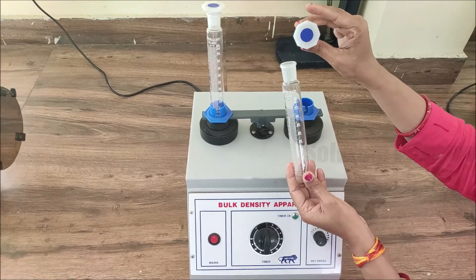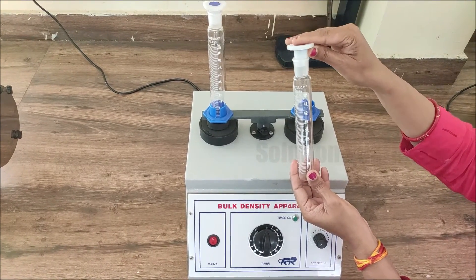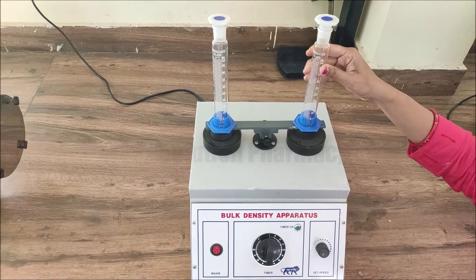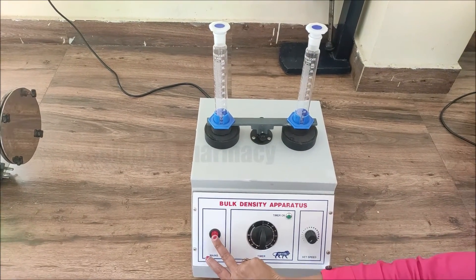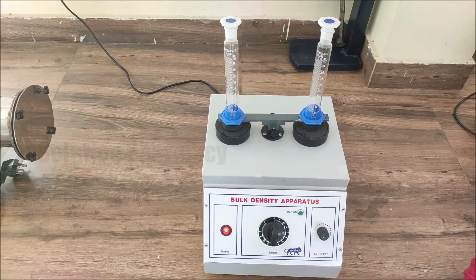Here you can see the cap of this measuring cylinder, and we fix this measuring cylinder into the holder like this. Next, I will demonstrate how we operate the bulk density apparatus.